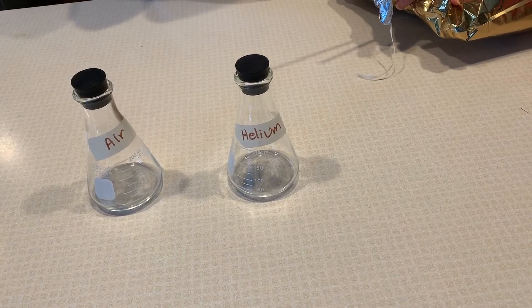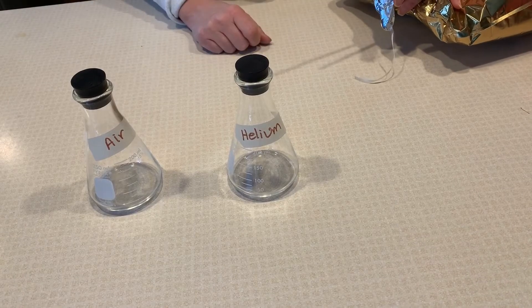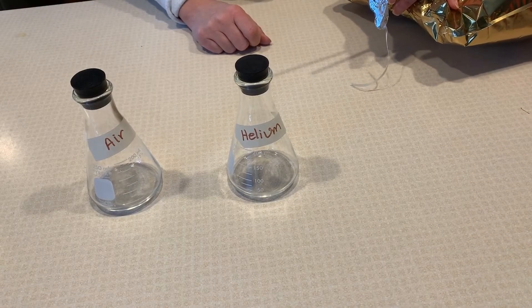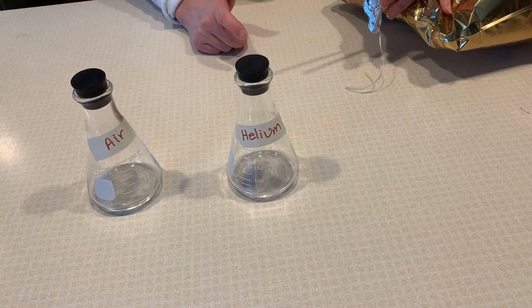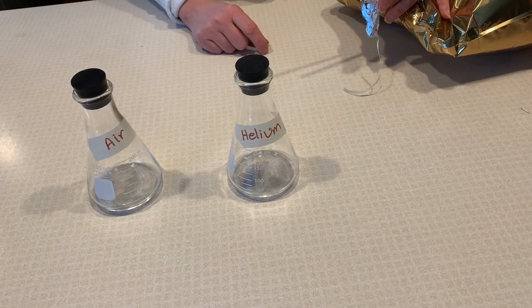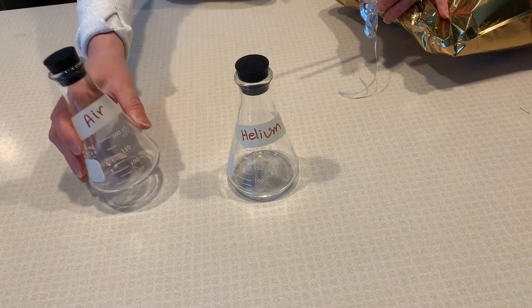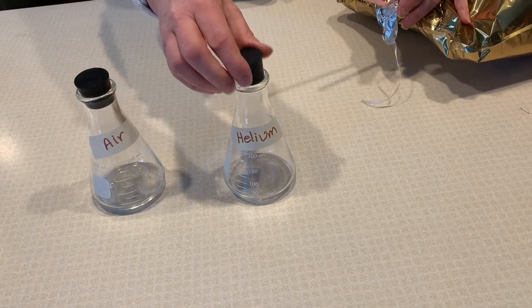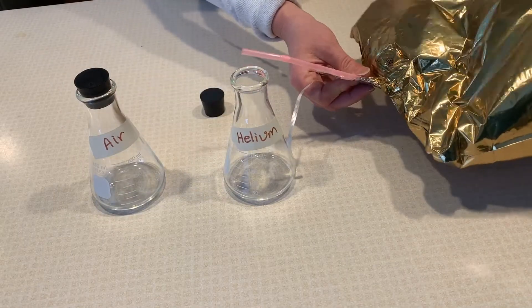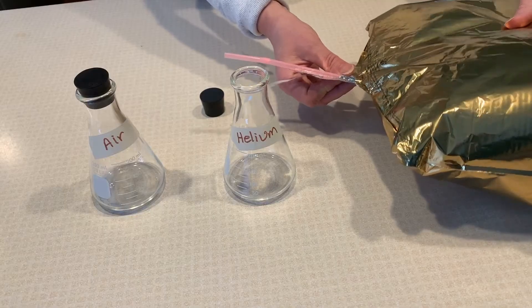We have two gases here that we're going to test. These are our control gases. Based on our property data table, we know what should happen when we test the flammability of both of these. I have one flask filled with air and one flask ready to be filled with helium from a balloon.